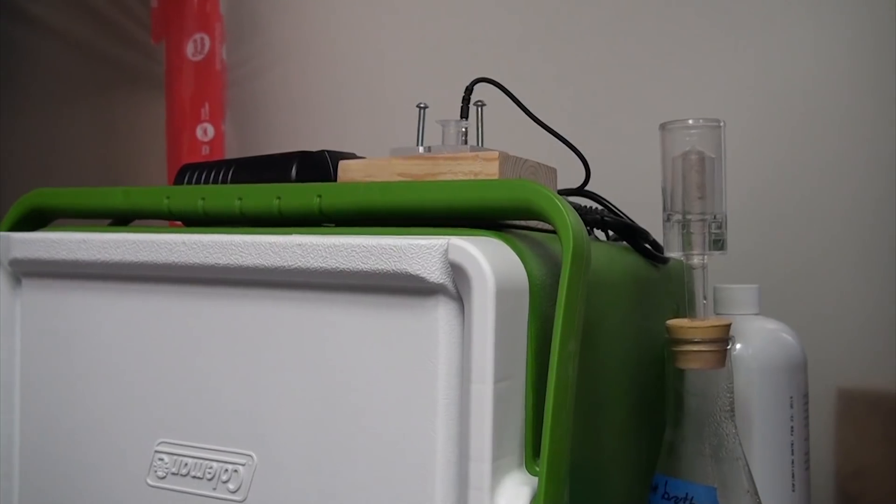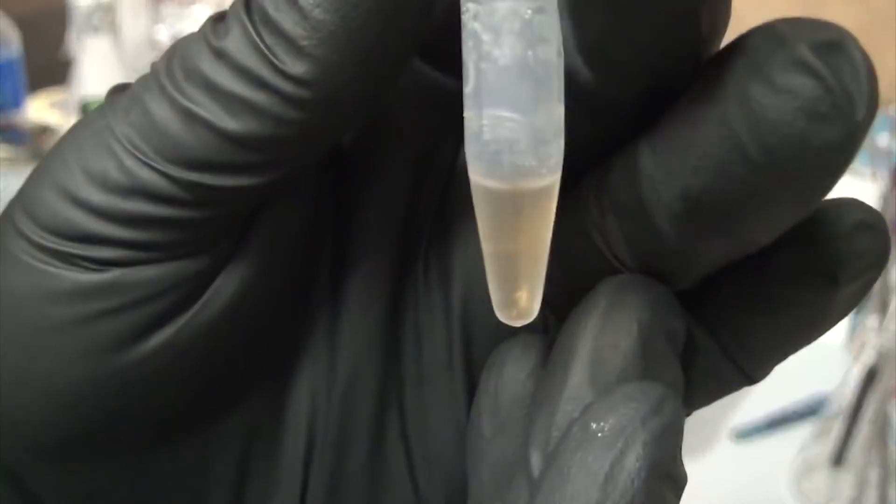This is the longest part of this process, and can take anywhere from 30 minutes to 4 hours. Before putting it in, the solution was murky and opaque, but after 2 hours, it had fully cleared, which is the stopping point.